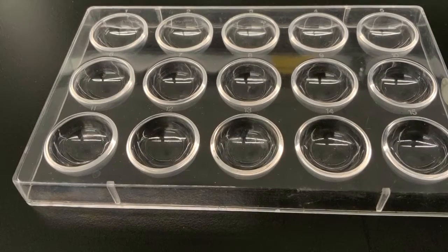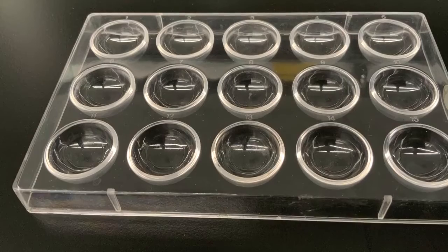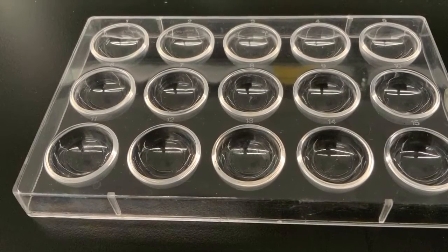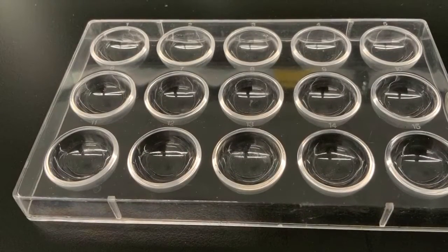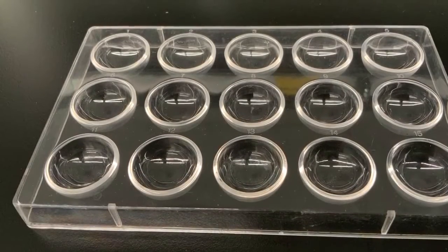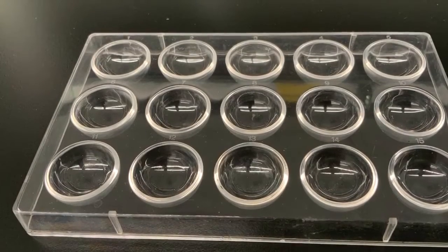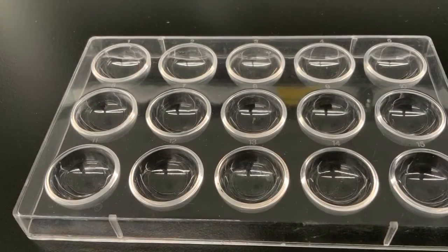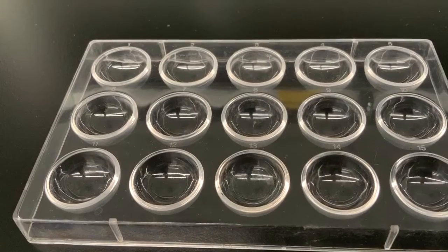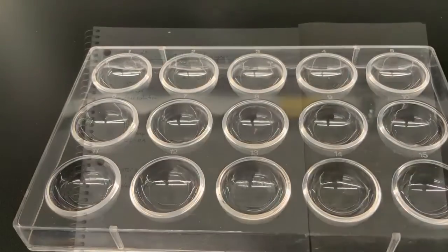The reactions in this lab occur on spot plates, which are porcelain or plastic plates that have these depressions called wells on them, sort of like potholes. They allow us to make qualitative observations with very little material and without causing a lot of waste. This is sometimes called microscale, but each well, each spot can hold 1 or 2 milliliters.